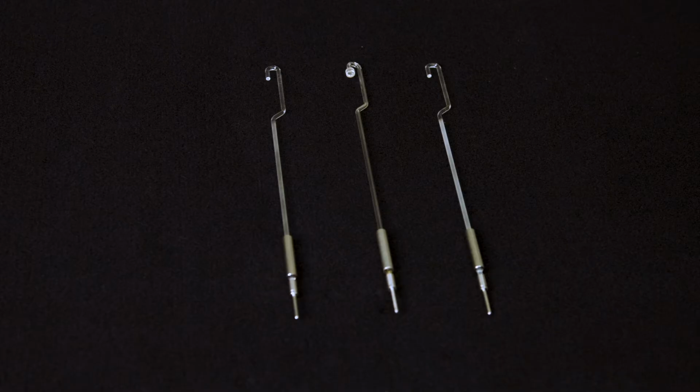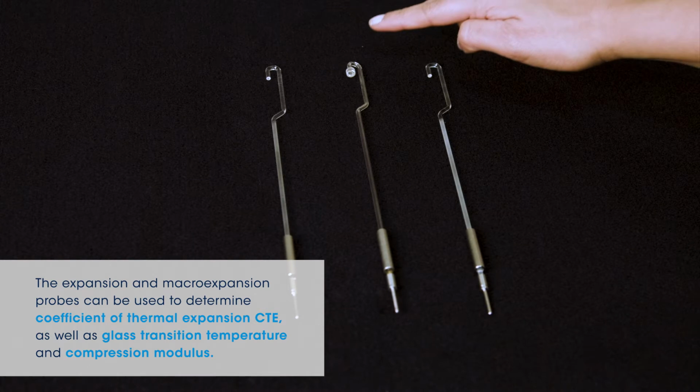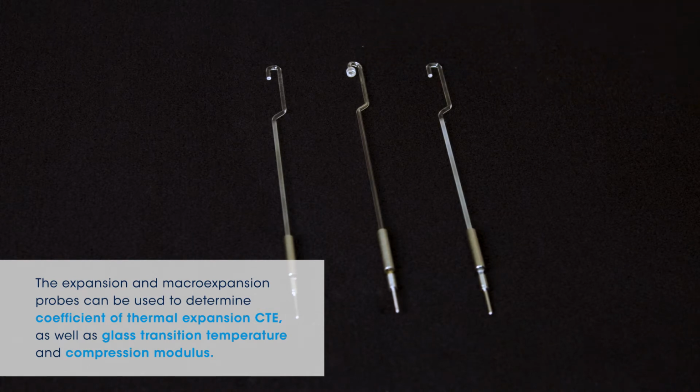In this tech tip, we will indicate how to switch between probes and how to calibrate the selected probe on the Q400 thermomechanical analyzer. The type of probe you choose depends upon the type of testing information you need. The expansion and macro expansion probes can be used to determine coefficient of thermal expansion (CTE), as well as glass transition temperature and compression modulus.